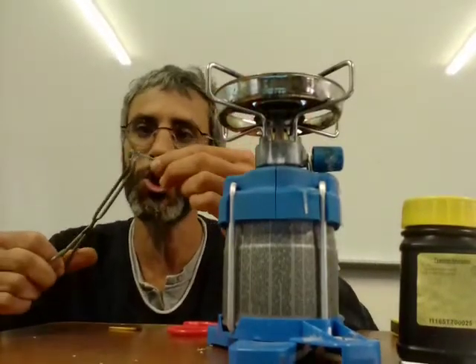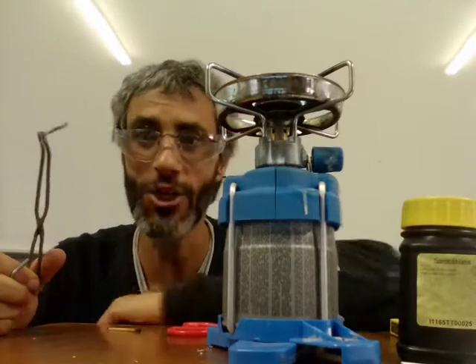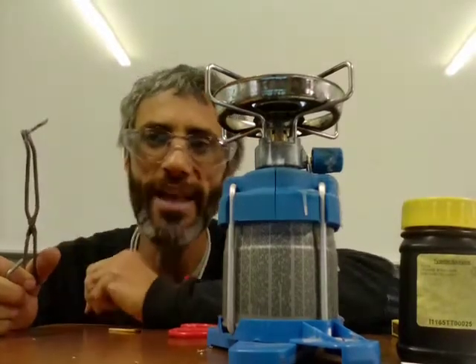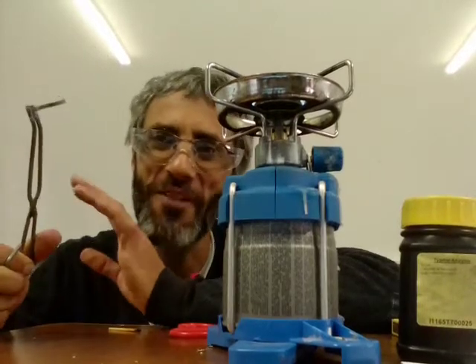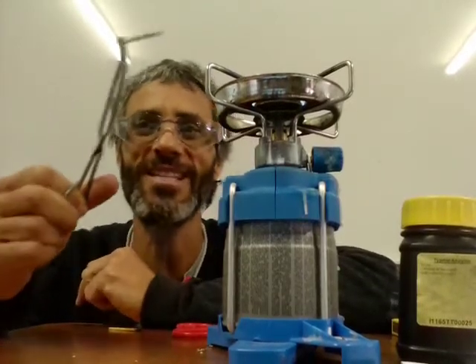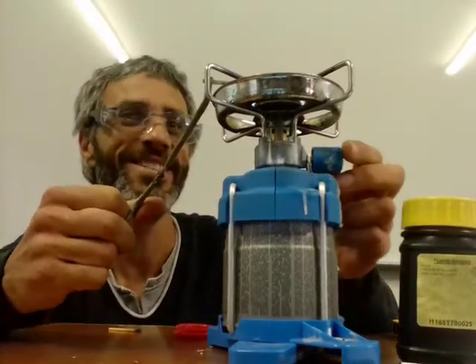Okay, so now if you were in this classroom, I would tell you when I'm burning this magnesium not to look directly at it, because it gives off a lot of light, and it can actually cause damage to your eye. Through the camera, I don't think it's as bad. But again, if I were you, I wouldn't look directly at the flame. So let's have a look at that. Don't look at the flame.